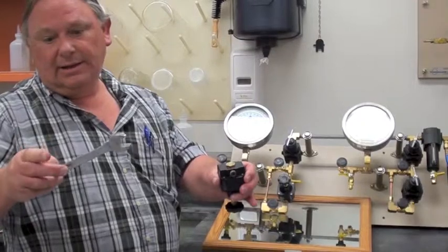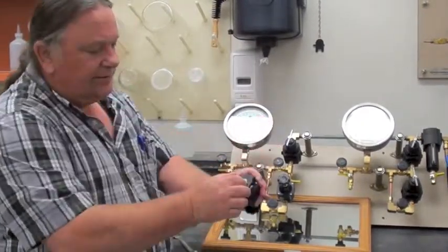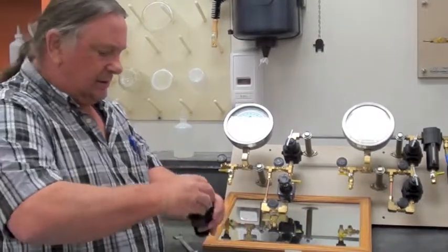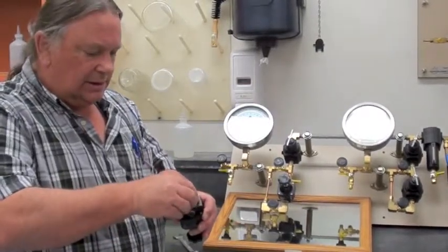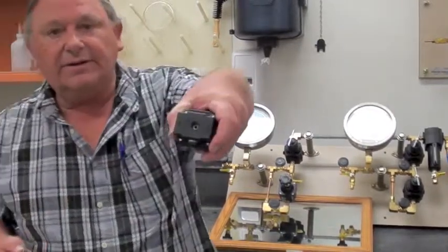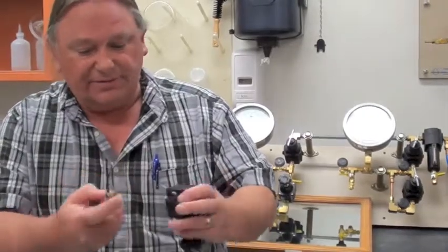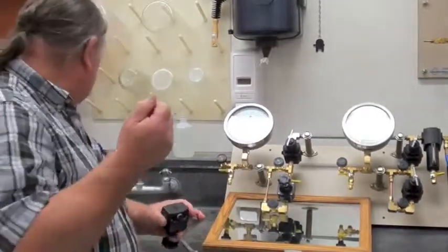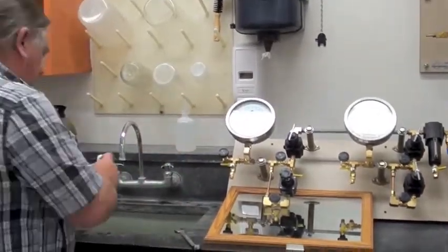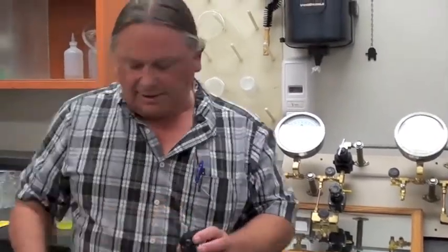Get a 3/4 inch wrench, loosen the brass part. There are some plastic fittings on here, and if you look, you'll see a white washer on the bottom. That probably has moved out, so then you'll need a wood dowel, something to go in there and press that seat back into place.